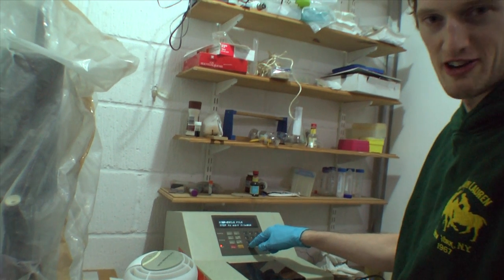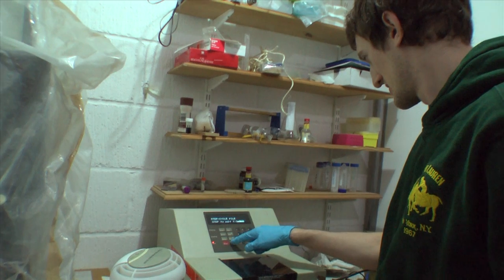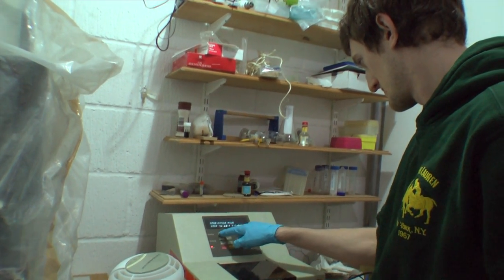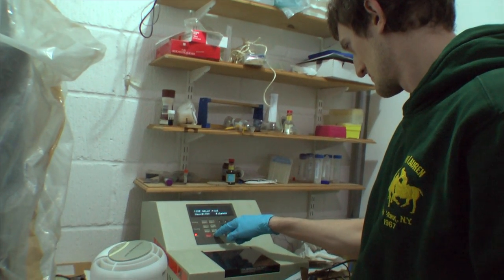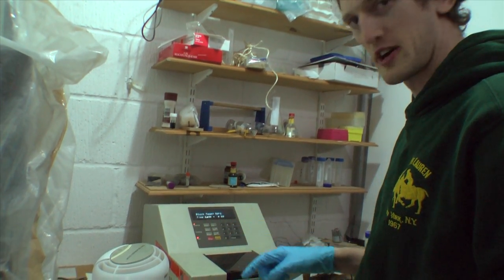So we're just going to start the PCR reaction, which will take about two hours.